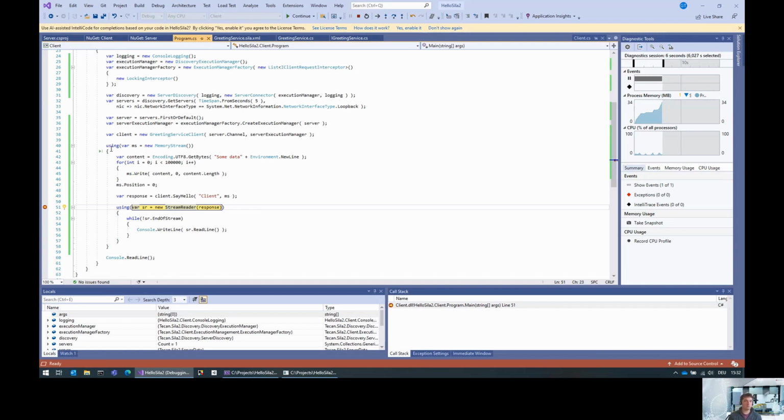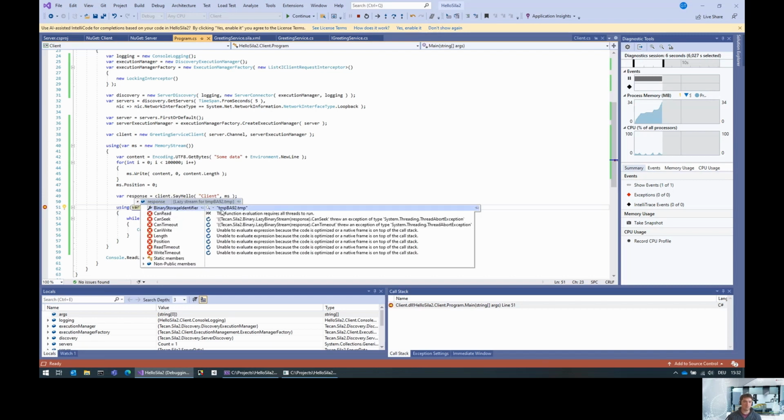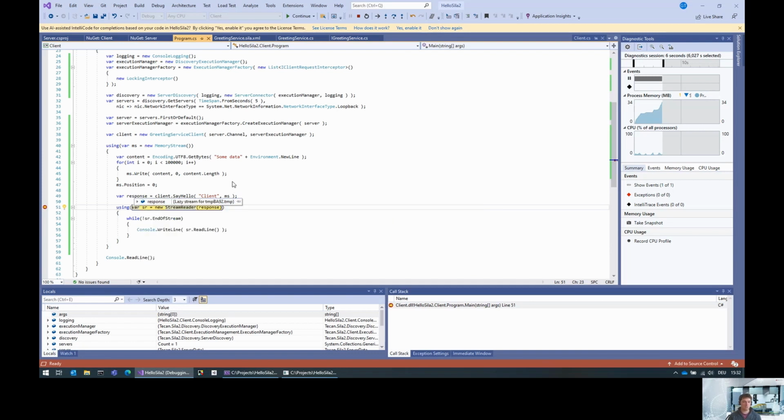Then the SDK takes the result of the command execution and stores it into a temporary file on the server side. Then it streams the file and creates a binary storage identifier, which, as you can imagine, is just the name of a temporary file, as you see here. The server stores the result of the call in a temporary file, uses the name of the temporary file as a binary storage identifier, and gives a response to the client with this binary storage identifier. And what this lazy stream does is wait for this to finish and then load this binary file. So basically the machinery is the same thing, and it's hidden completely from you as a user.